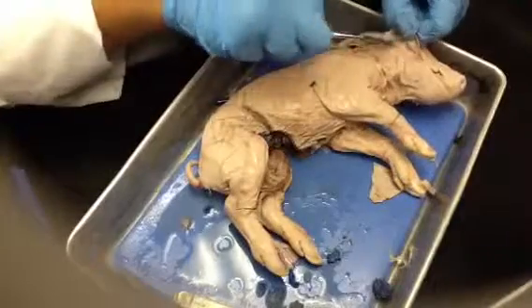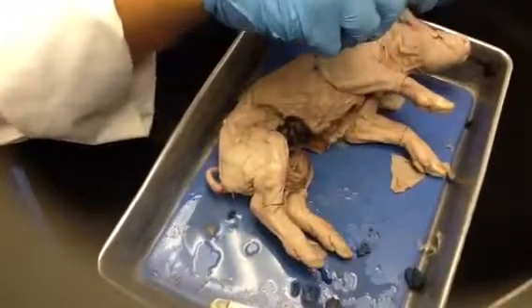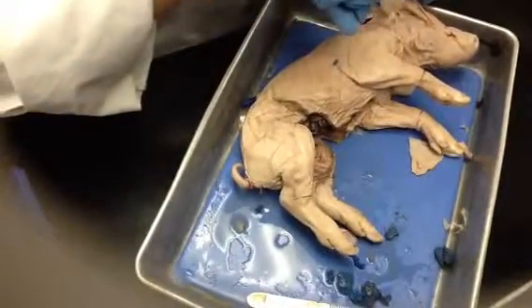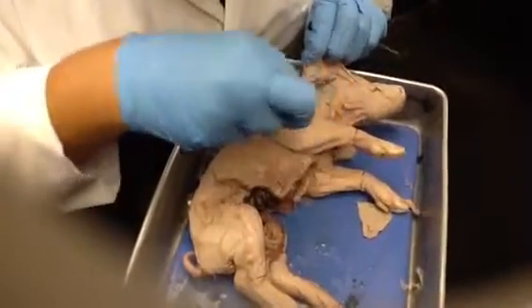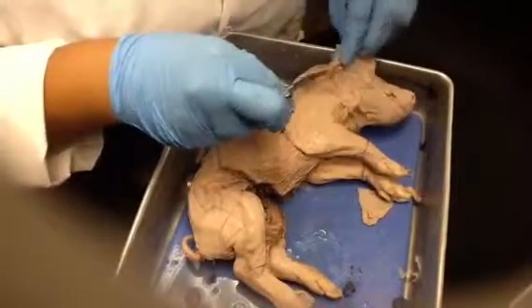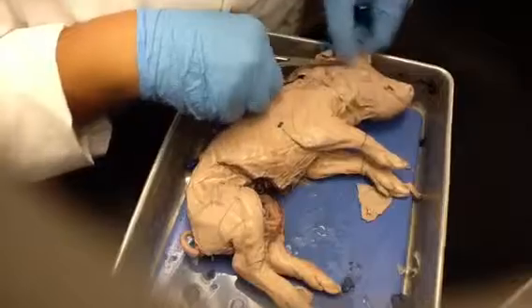Did I just break it? I think I cut it too. I think it's this one here. That seems very superficial though, but I don't see it anywhere else, so I see that one.